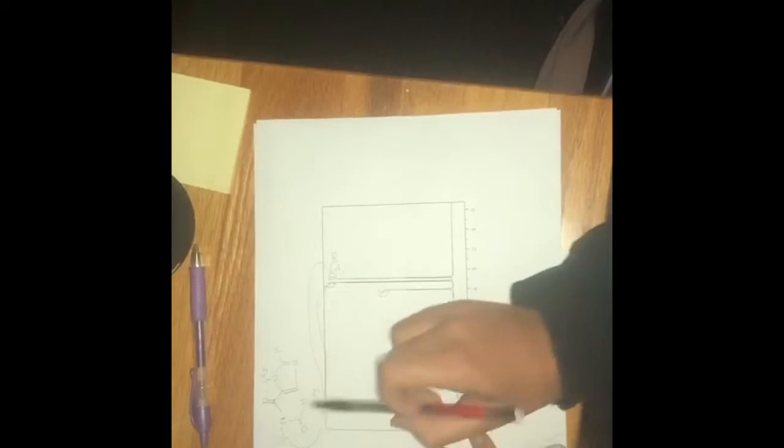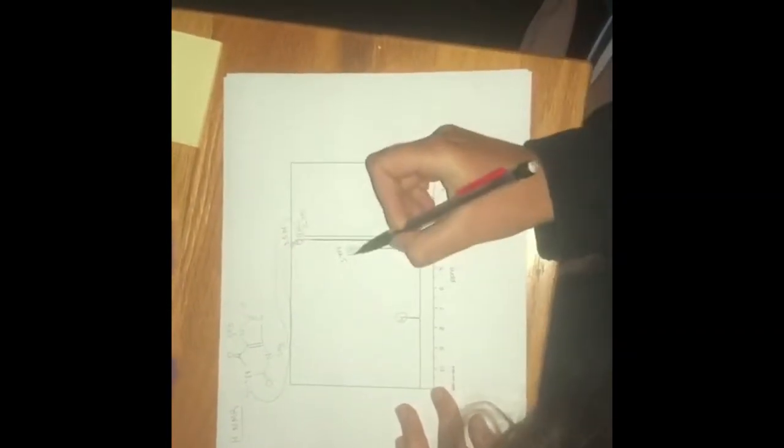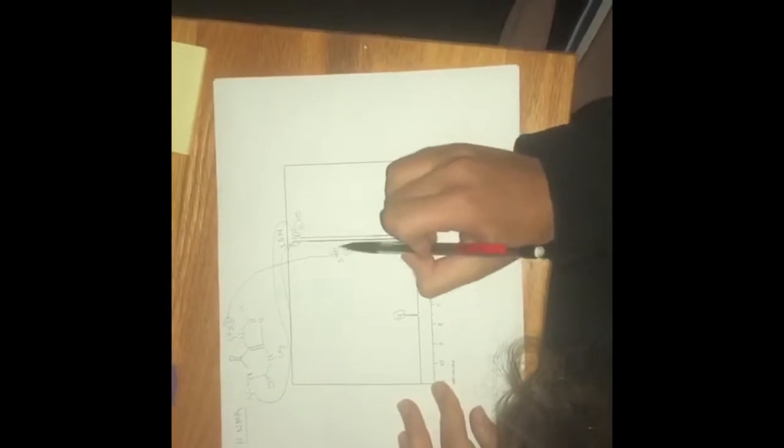So for number 2, we're going to label it as these hydrogens right here, next to this nitrogen. They're the second least deshielded, and that is at 3.574 ppm. And then we're going to label these 3.999, and that matches up with these hydrogens right here. And so they're a little more deshielded than these other ones right here. So this one's 1 and this one's 2.